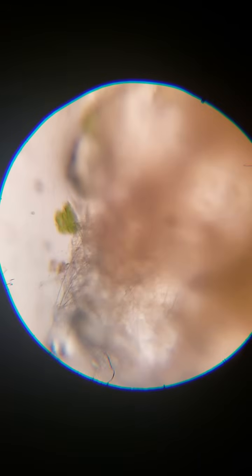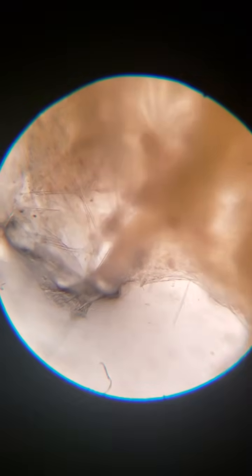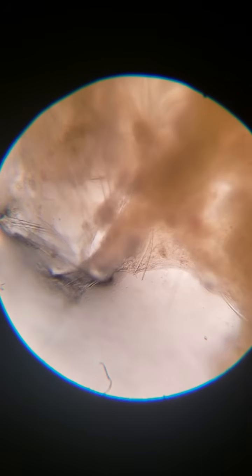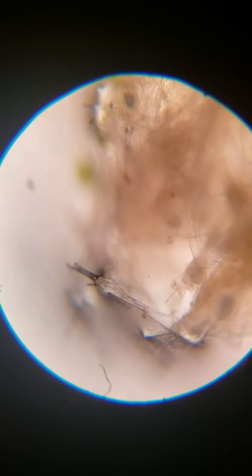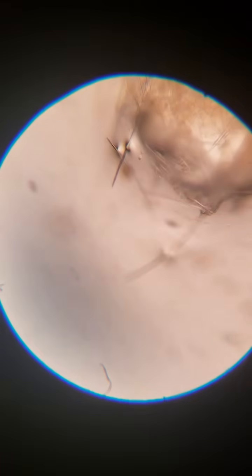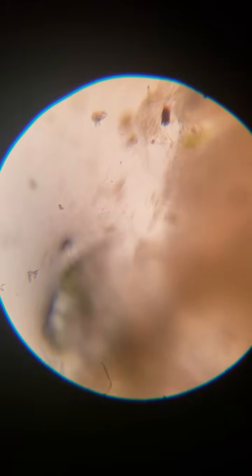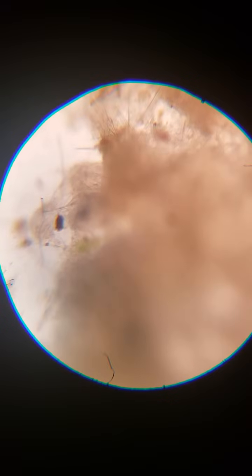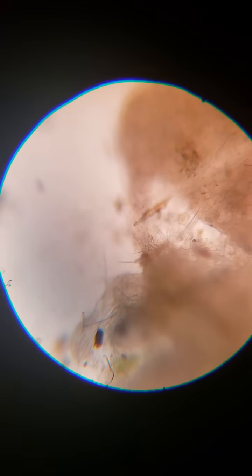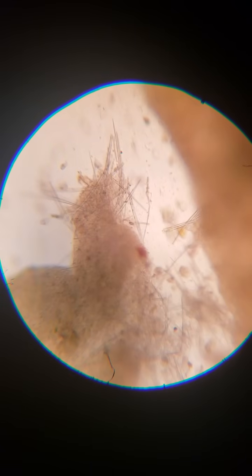Like over here, you can see how the crystals actually start forming by getting super dense, and the ends of those little spears. Some of the cells that look like spears are just tasked with catching things that float by and pulling them in, or I guess stuff gets stuck on it and then the cell grows around it.